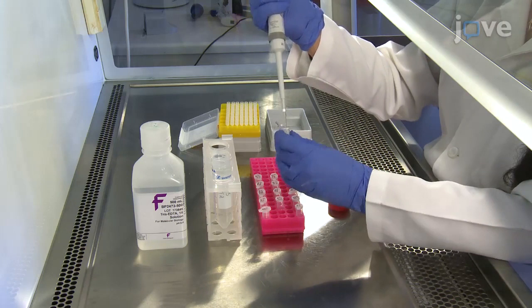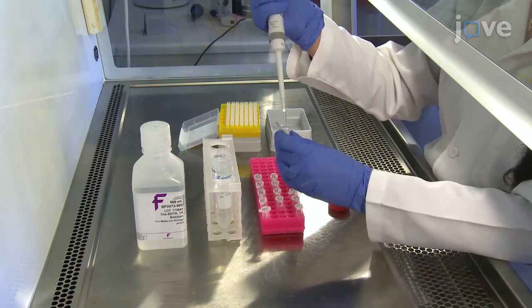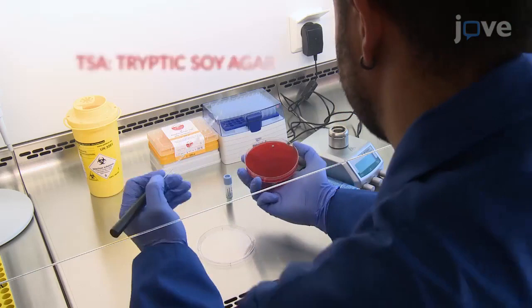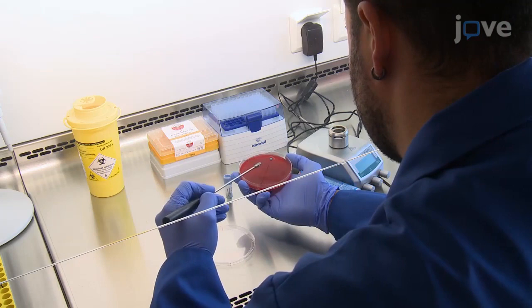For bacterial culture on solid medium, roll a single porous glass bead from cryogenic storage directly onto one culture dish containing TSA supplemented with defibrinated sheep blood to streak out individual bacterial colonies. Then place the plate at 37 degrees Celsius for 24 hours.